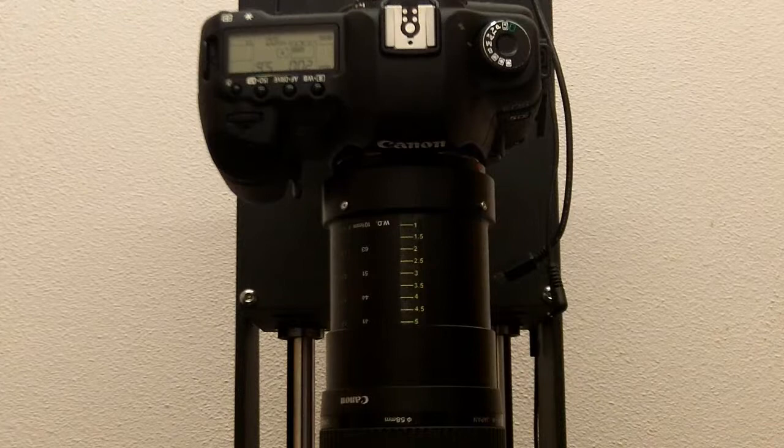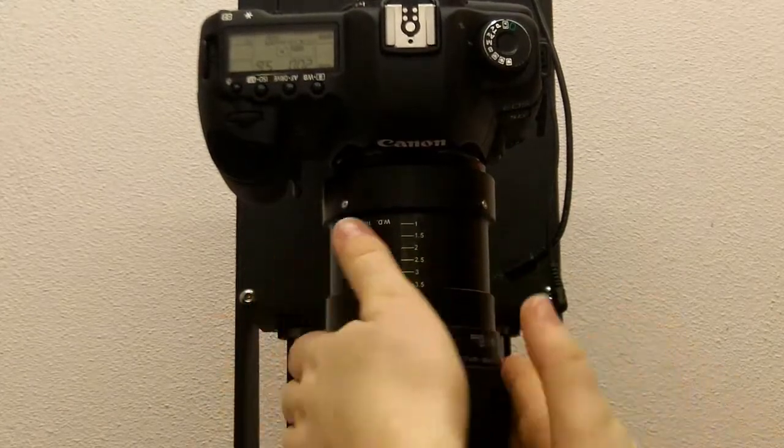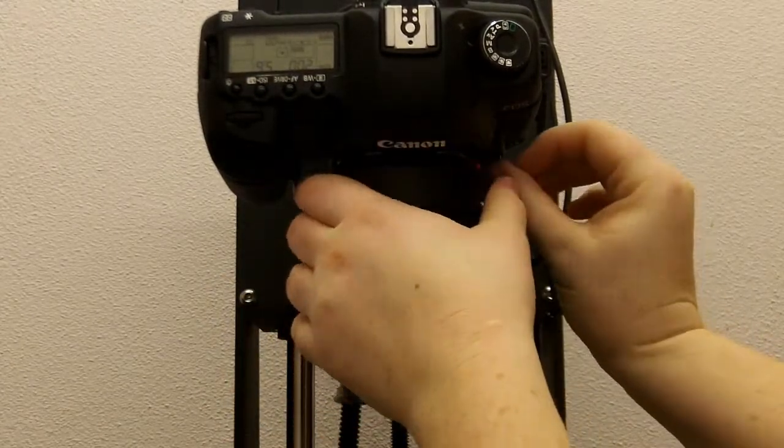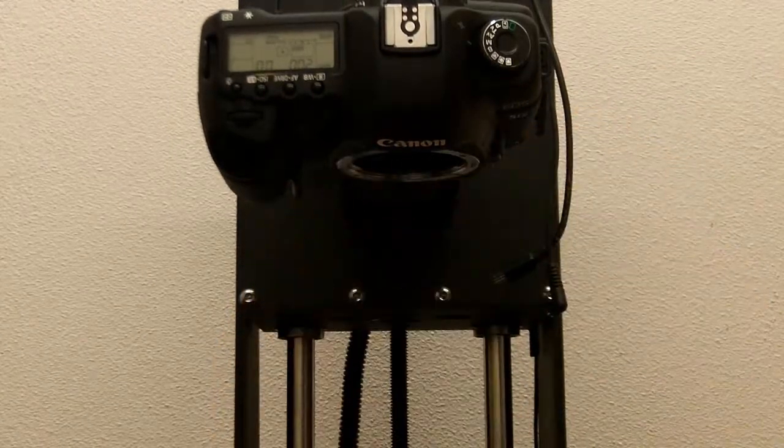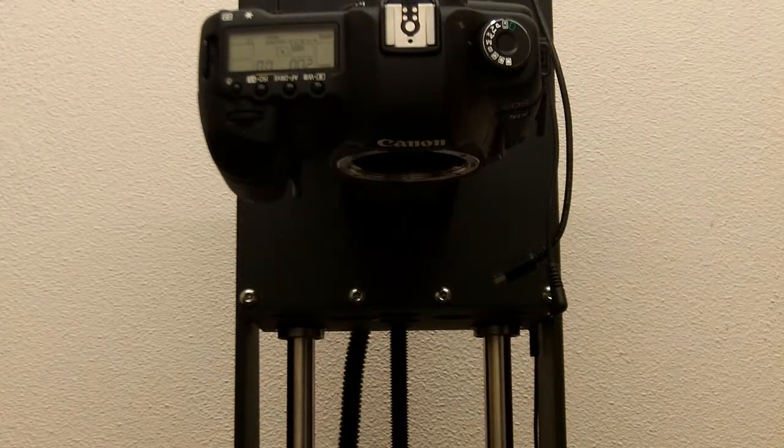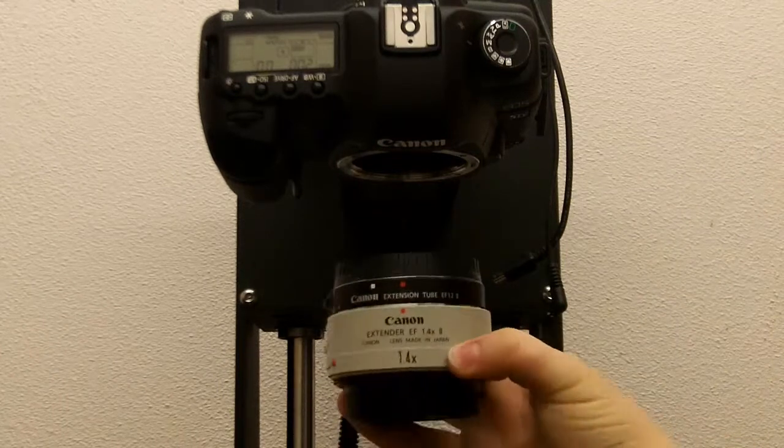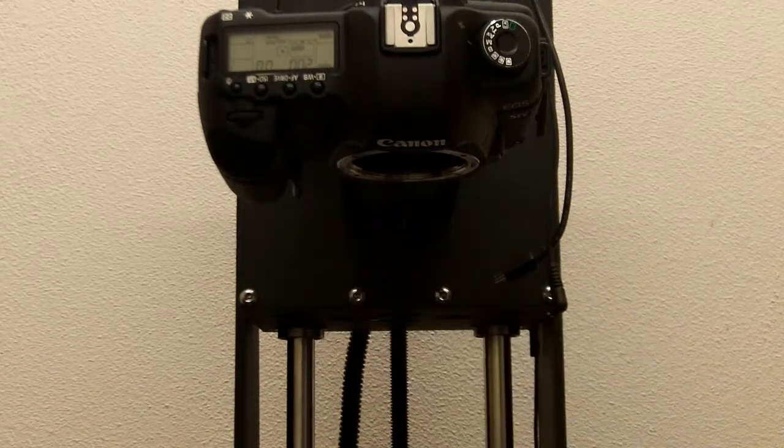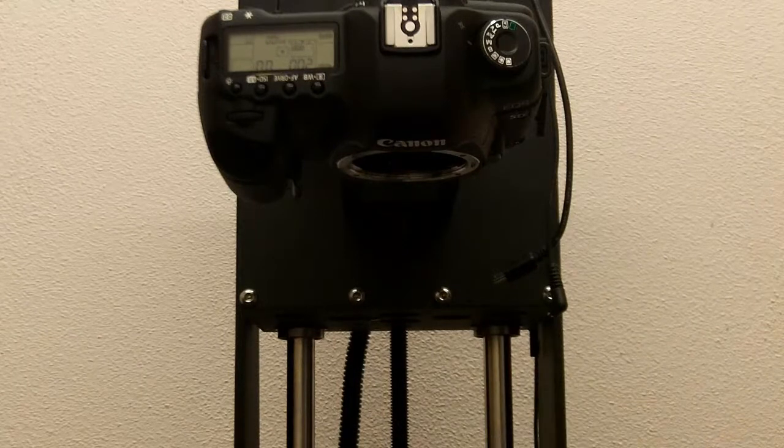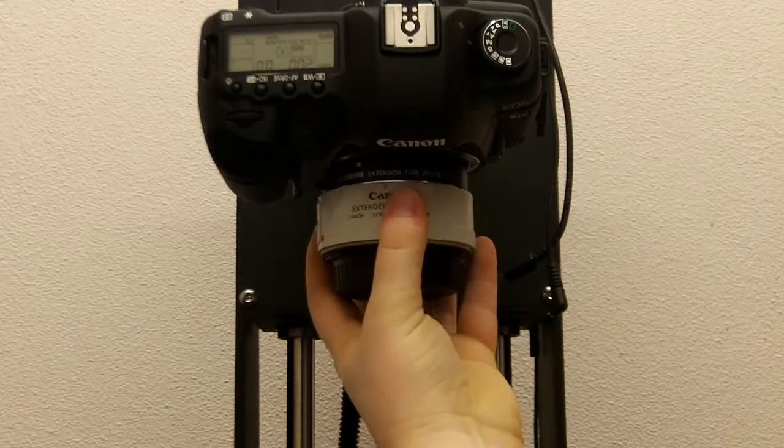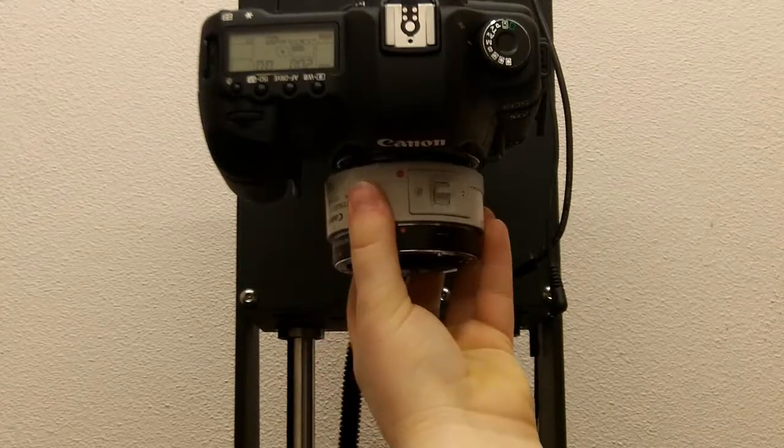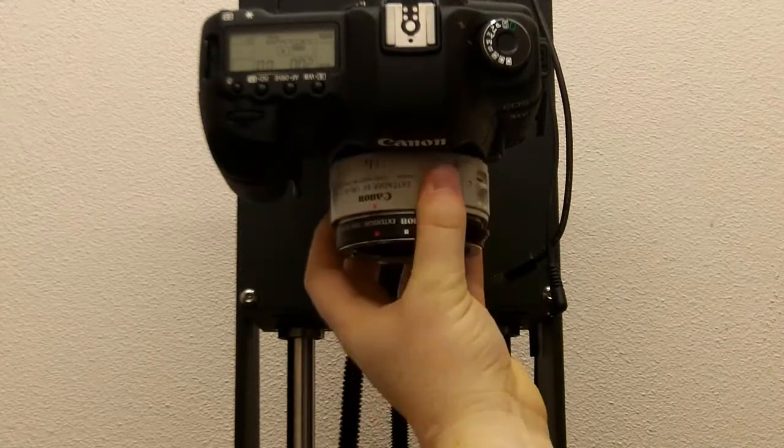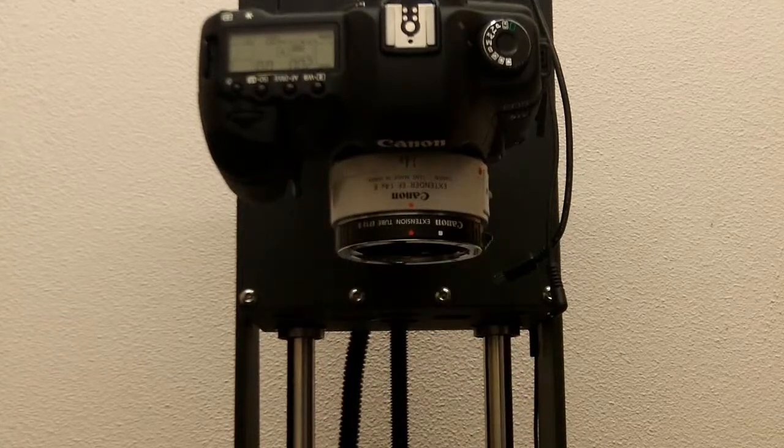So, if you are imaging something, and you need to increase the magnification a bit, and you have already gone as high as you can, you can attach this 1.4x teleconverter. So, it's basically an extension for the lenses. Simply attach the teleconverter to the lens.